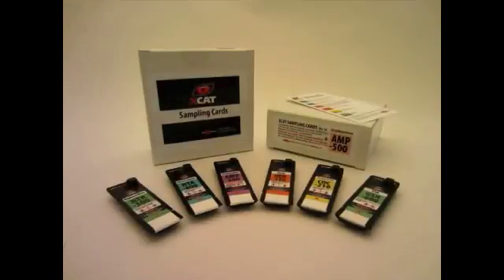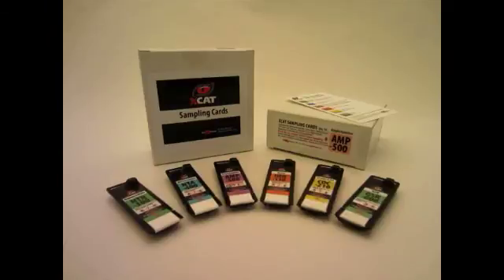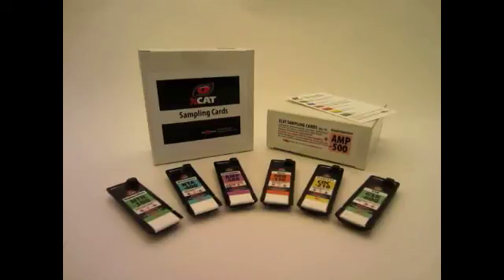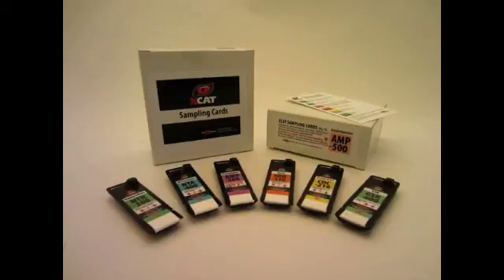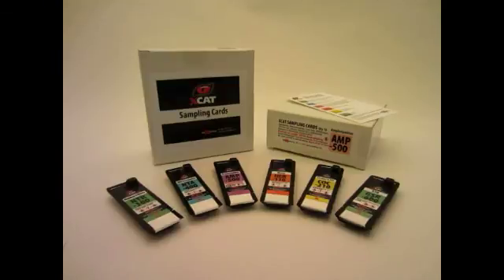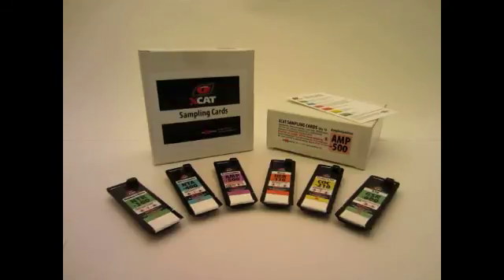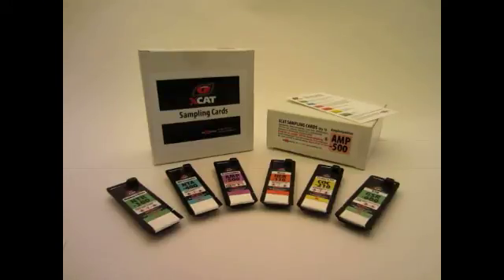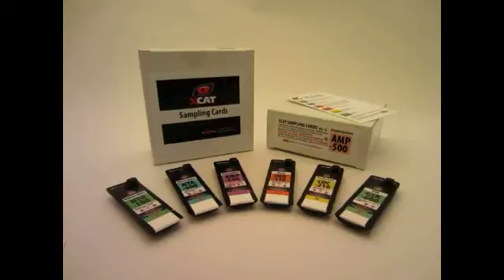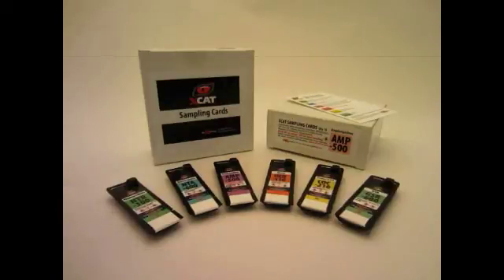XCAT uses detection cards with specially formulated optical detection inks and software to identify characteristics unique to an individual or group of chemically related analytes. Each individual analyte or group of analytes is detected with a dedicated sampling card. Six sampling cards are currently available.